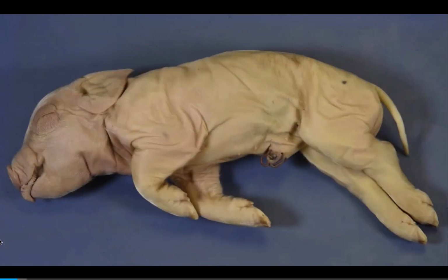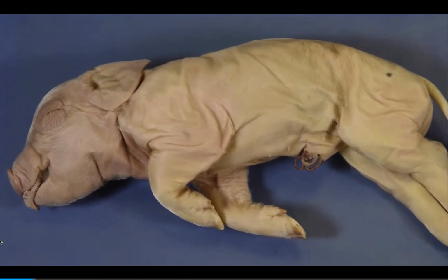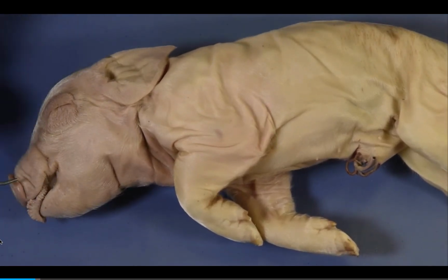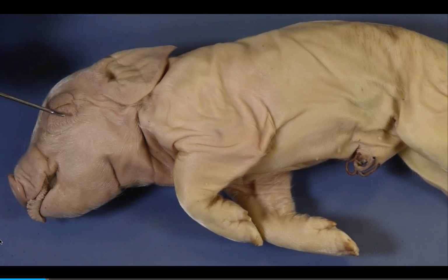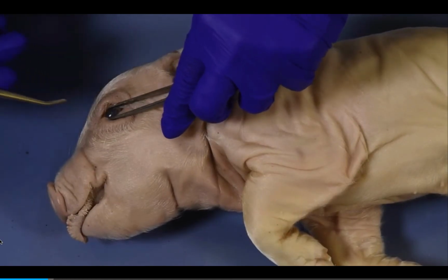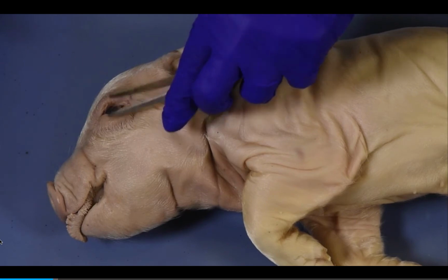Let's review the surface anatomy of the fetal pig. The main regions of the body are the head, the trunk, which comprises most of the body, including the appendages, and the neck, which is located between the head and trunk. The head includes the mouth, external nares or nostrils, which are located at the end of the snout or rostrum, auricle or external ear, eyelids, and nictitating membrane. The nictitating membrane keeps the eyeball clean by separating the upper and lower eyelids and is visible when the eyelids are pulled apart.